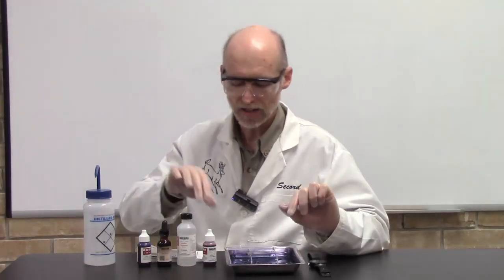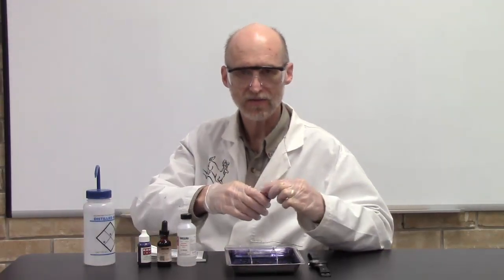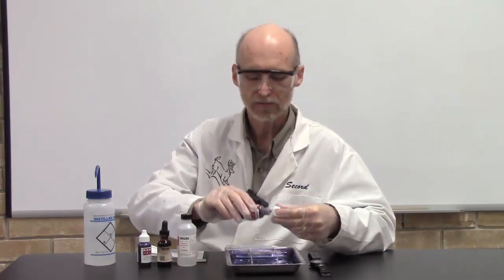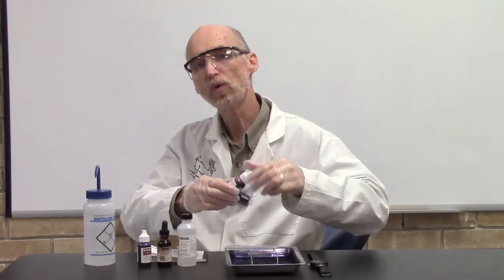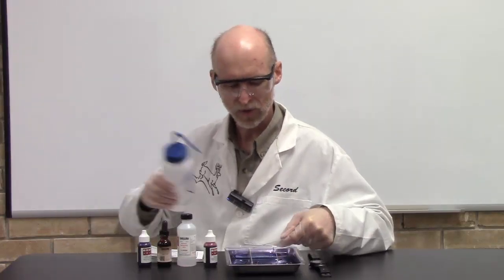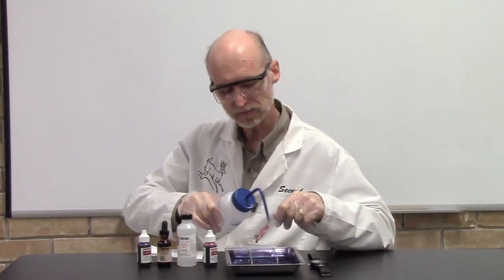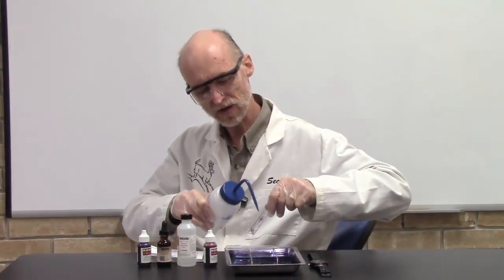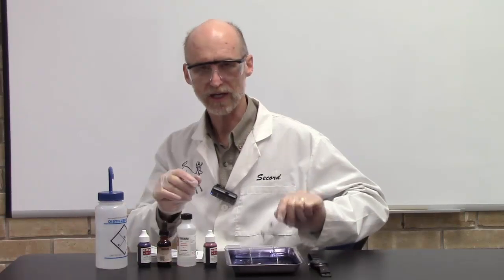Finally we apply our safranin. Put a couple drops of safranin on the bacterial smear and we're going to leave that for 45 seconds. After 45 seconds is up we rinse the slide. Get all that safranin off and now we're ready to blot it.